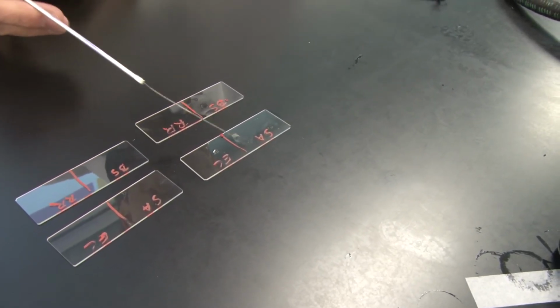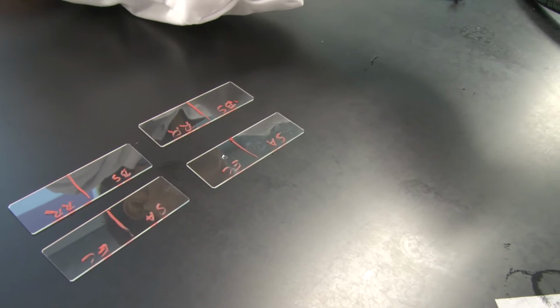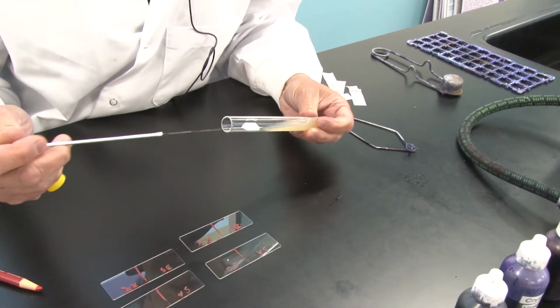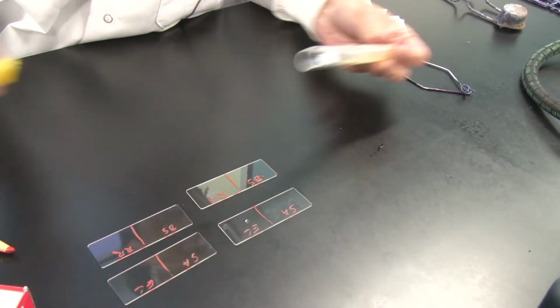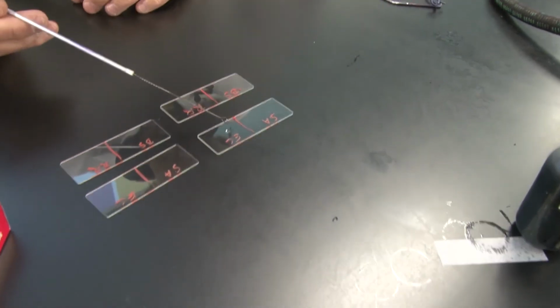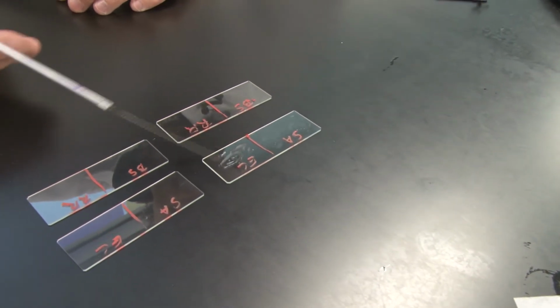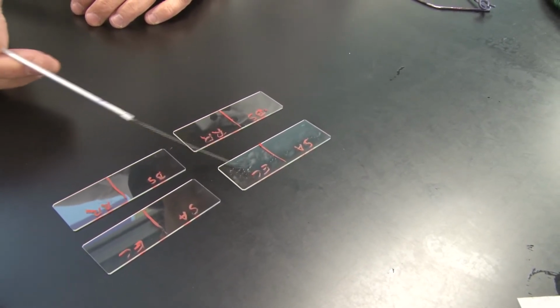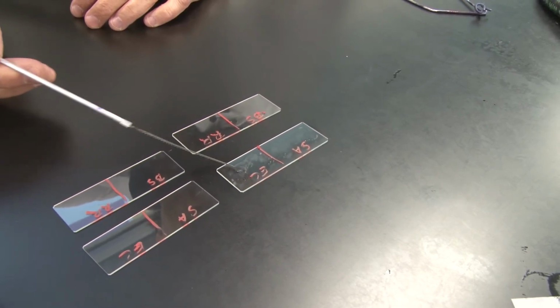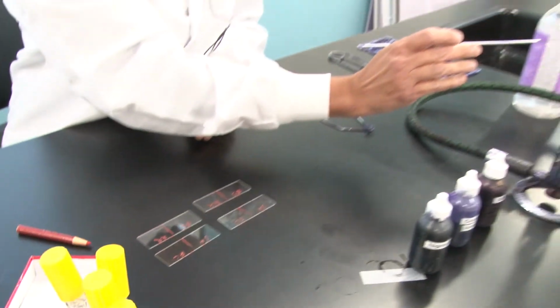I'm going to let that air dry, but did you notice that I've spread that entire little loopful all around that half of the slide? Okay, I'm going to flame my loop. I'm going to go back into our next stock named E. coli. Escherichia coli, everybody's heard of, simply referred to as E. coli. Put that back in the rack, and I'm going to drop that down into the loop full of water. Again, I'm going to spread it all over the surface on this half of the slide. Notice that the water is a little bit turbid. Okay, so I know I've got bacteria in there.